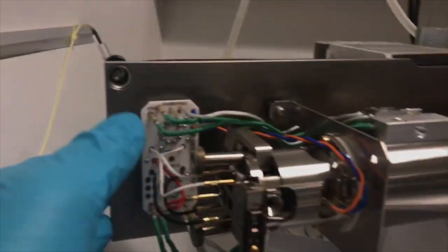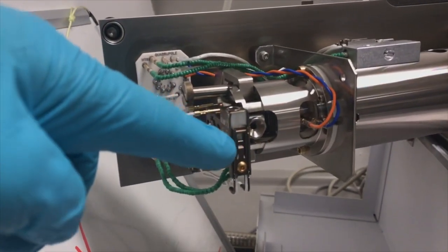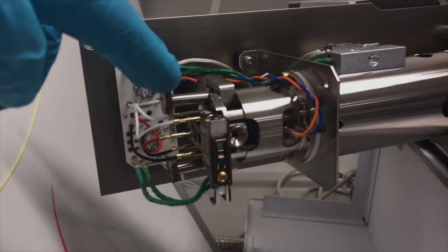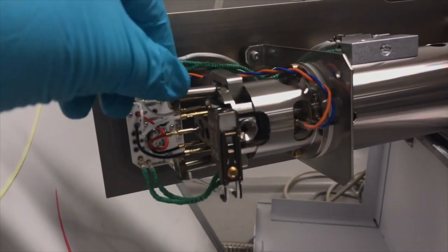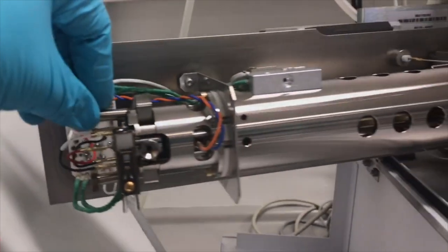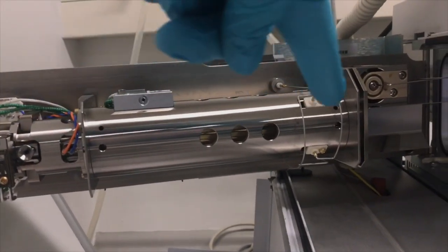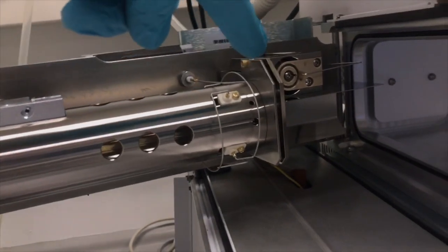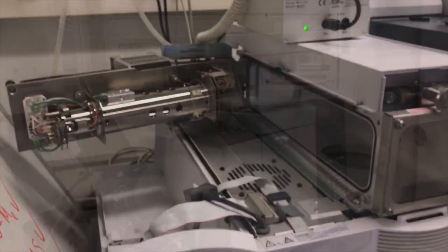And this part, we call it an ionization chamber. Here the fragmentation of the molecules is occurring. And how it's occurring: inside we have a filament which actually bombards molecules with 70 electron volt electrons, and they break down the molecules, and the molecules will then travel through a quadrupole mass analyzer which separates ions based on their mass to charge ratio and reach the detector, and we get a signal. So this is how the MS spectrometer works.